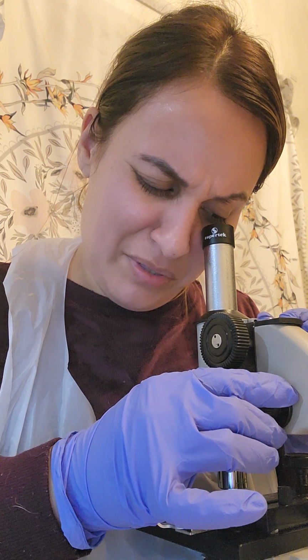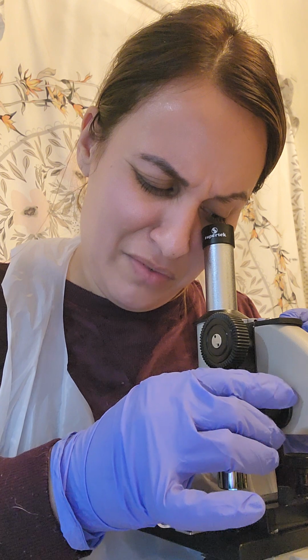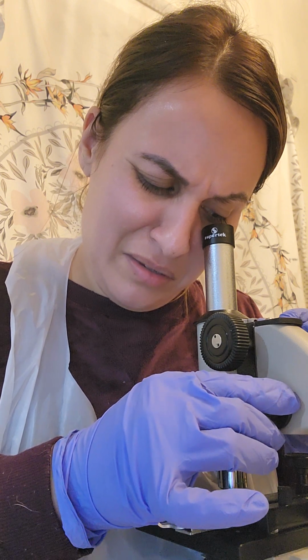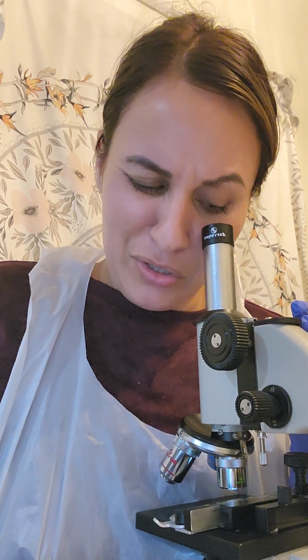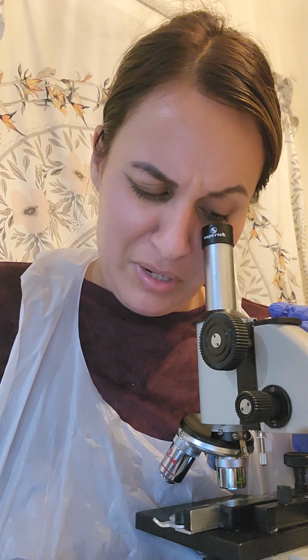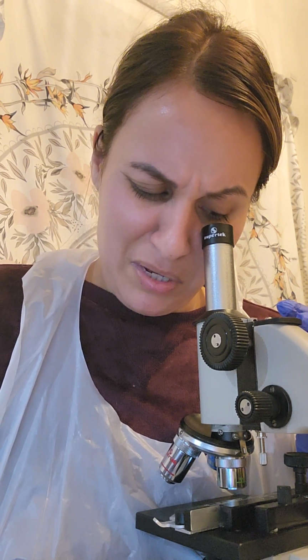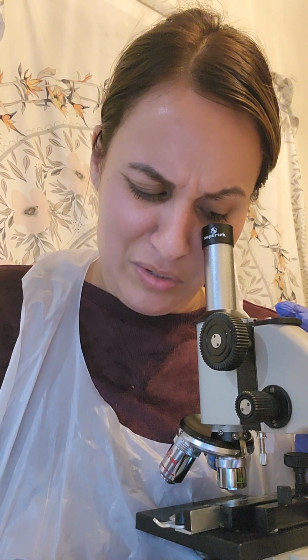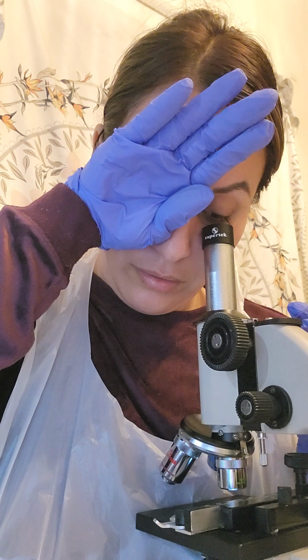My eyes are really horrible, so this is a little challenging for me. I'm doing double work because I can't take pictures and do a video, so I've already taken pictures of these slides. It's taken me a long time to do this assignment, but I feel like I'm getting better because I've used the microscope a little bit longer.